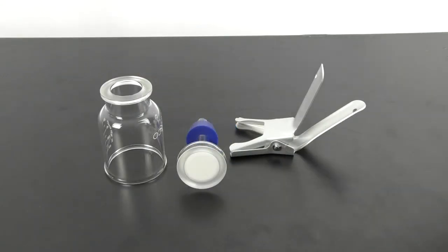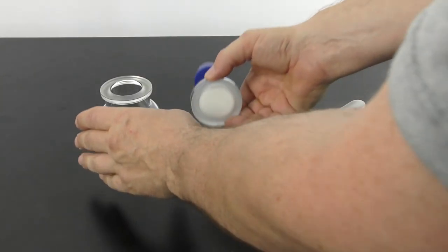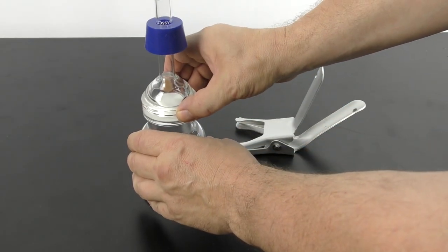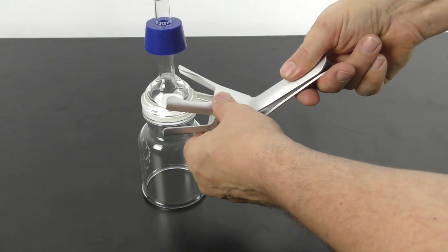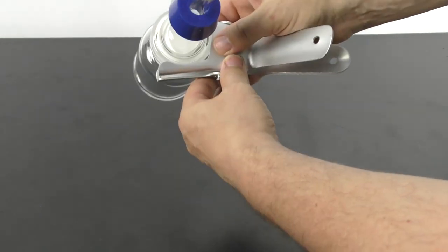The assembly is very straightforward. Place the funnel open side down, place the membrane section on top, and then connect the two with the clamp.